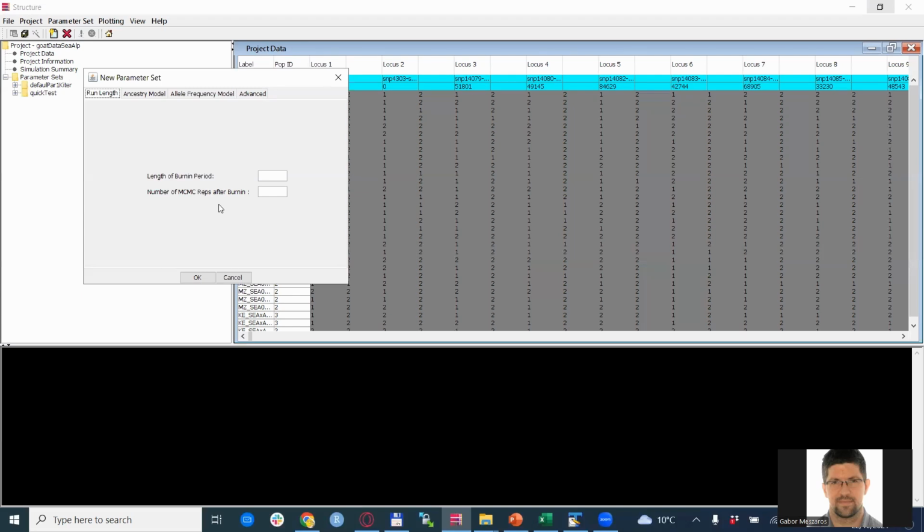Of course, considering the size of your data, but if you are dealing with SNP data, then this runtime could be considerable. For the purposes of this example, we will set just a very low number of iterations, so it finishes quickly, and then I can proceed with the demonstration. But for the proper analysis, please check the papers that were published on this topic and try to see what numbers of iterations were used there.